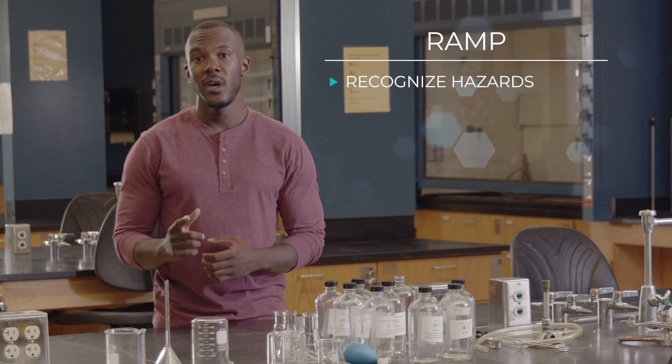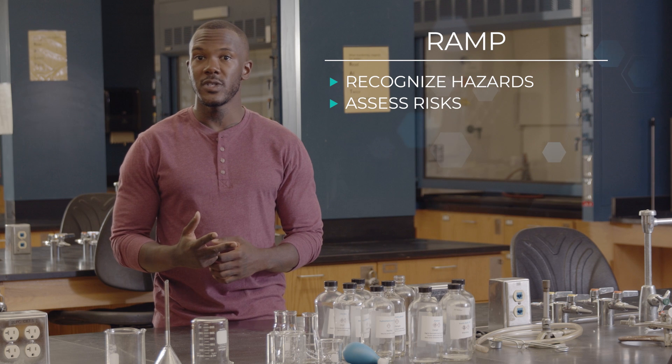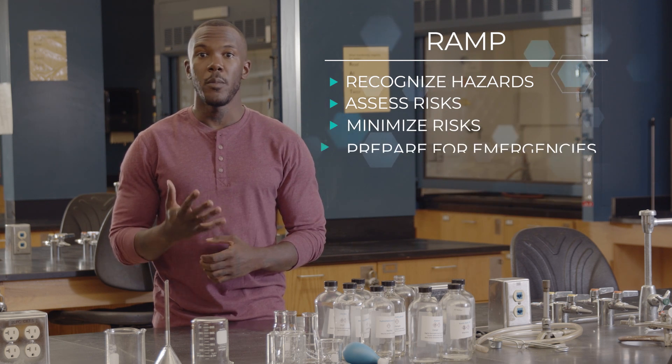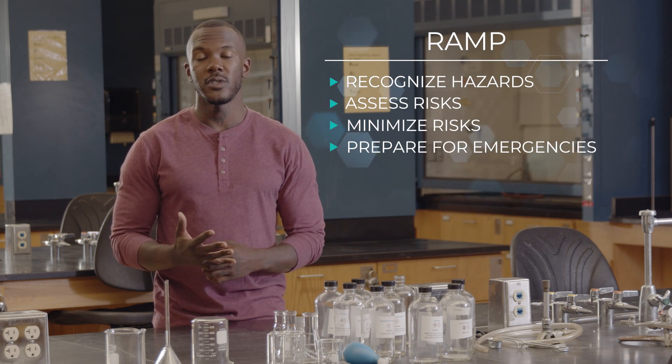As you move through chemistry classes, you'll encounter many lab situations where general rules need some adjustment based on risk management. The steps for managing risk can easily be remembered using the acronym RAMP. RAMP stands for Recognize Hazards, Assess the Risk, Minimize the Risk, Prepare for Emergencies. Let's briefly take a look at each one.